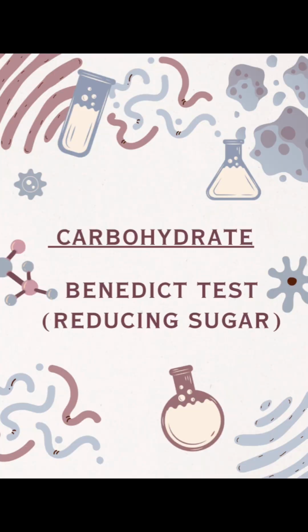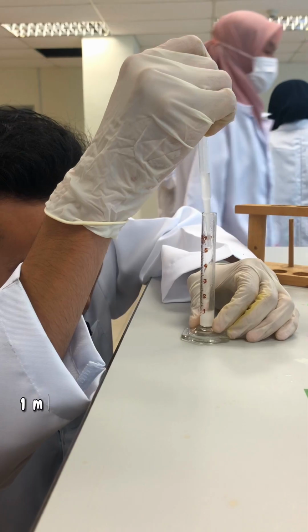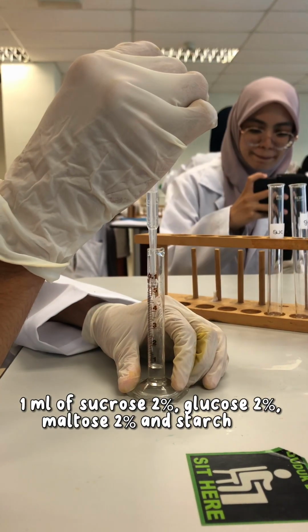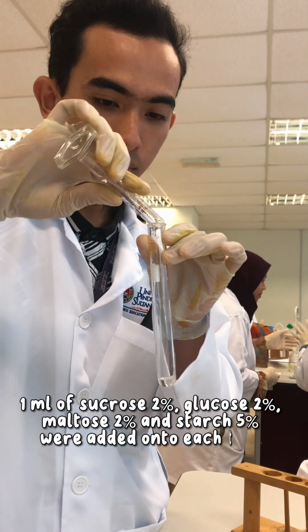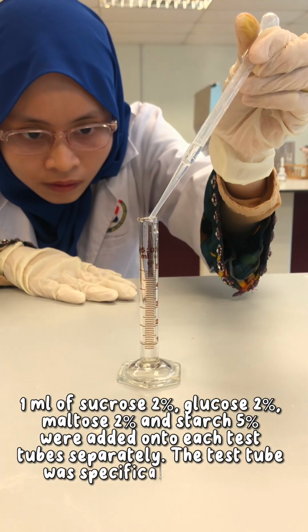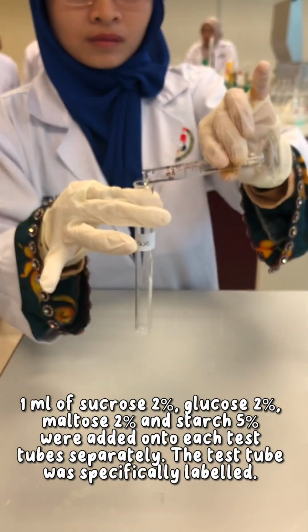Benedict test, which is for reducing sugar. Firstly, 1 ml of sucrose 2%, glucose 2%, maltose 2% and starch 5% were added into each test tube separately. The test tubes were labeled.